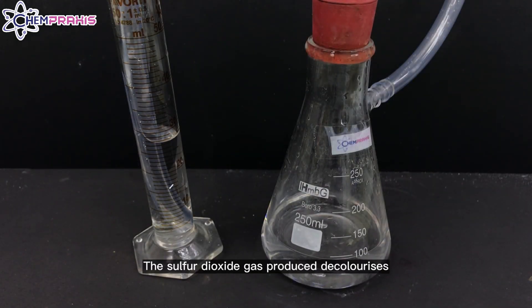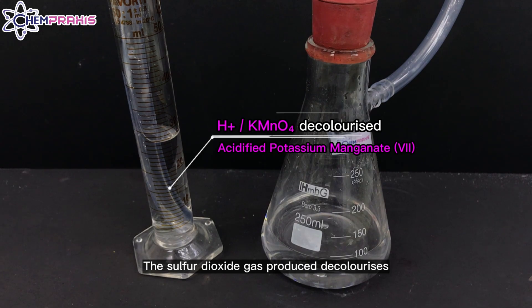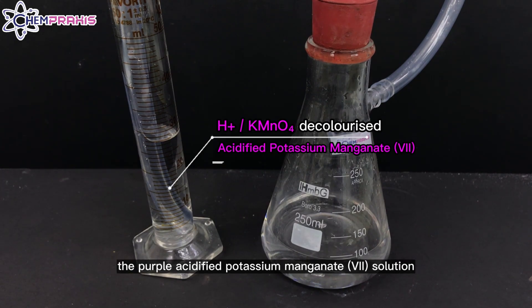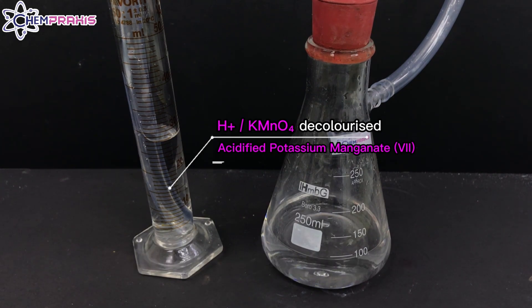The sulfur dioxide gas produced decolorizes the purple acidified potassium manganate solution.